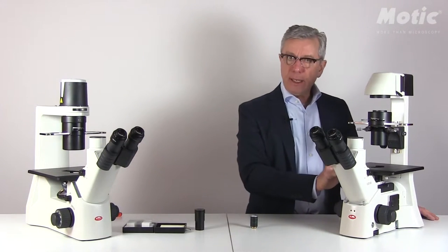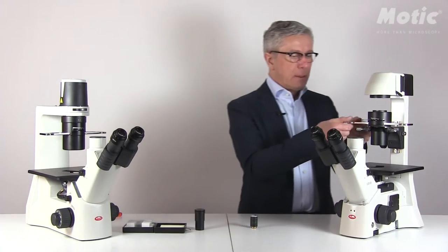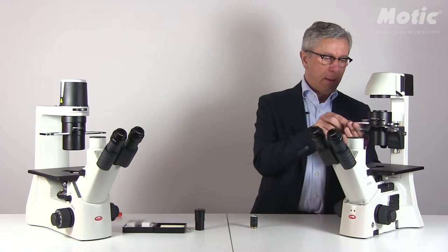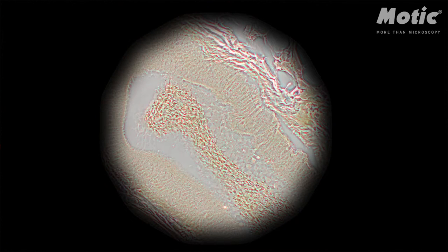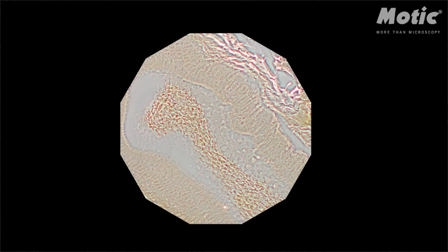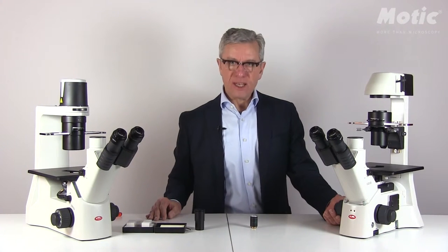For the AE31 Elite you have to do some more handling. Place your sample on top of the stage and focus. Move the slider into an empty option. Close the field diaphragm and move the condenser in terms of height until you get the bright spot in the middle of your field of view. Then open the field diaphragm again and adjust the contrast by using the aperture diaphragm. With all these handling procedures the Köhler setup has been done properly.